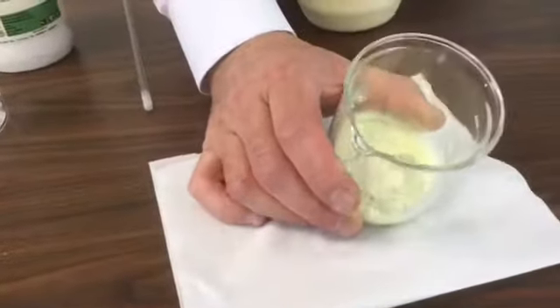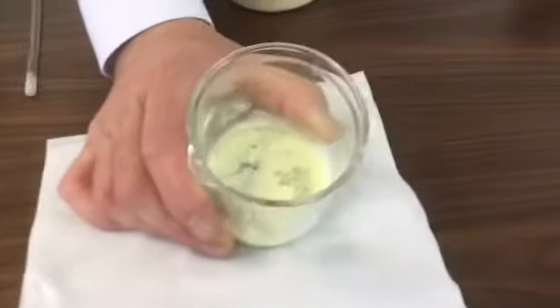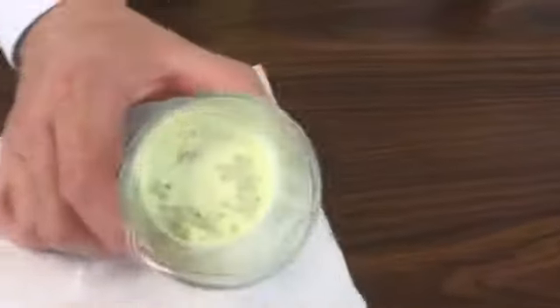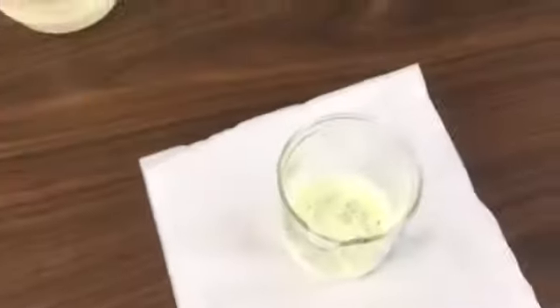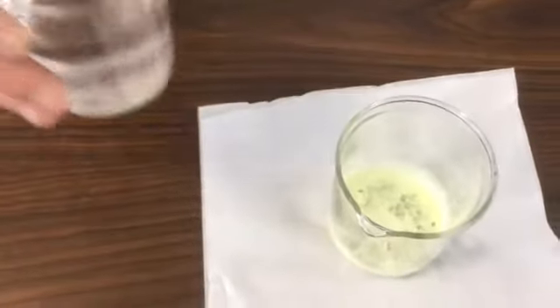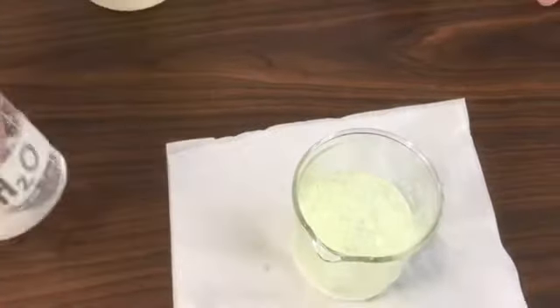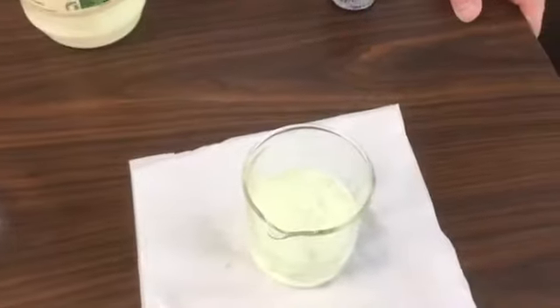Imagine you are going to take every particle of sulfur to separate them, or every crystal of sodium chloride, but it's very important to learn about the methods of separation of mixtures. First, to perform the separation, I'm going to put in a portion of pure water. I am going to stir.